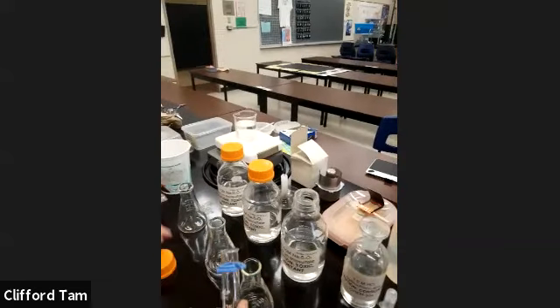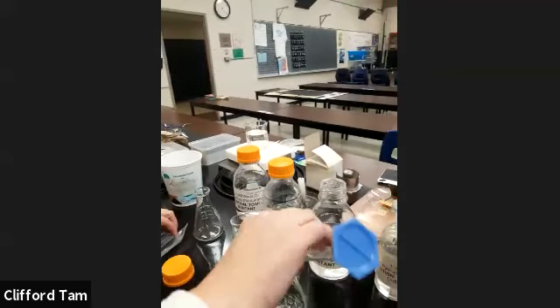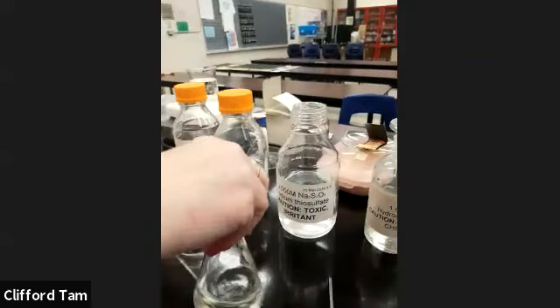Now, at the same time, we're going to start the timer. Yeah, we're going to start the time. We're just going to see. So as you guys can see right here, 0.05 is the weakest out of all of them.